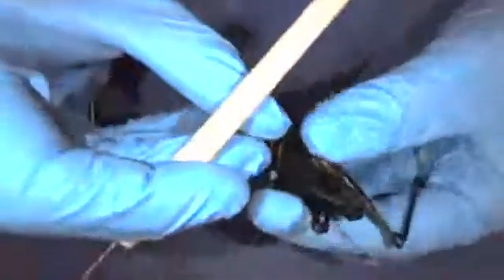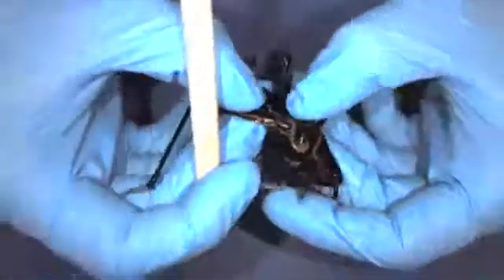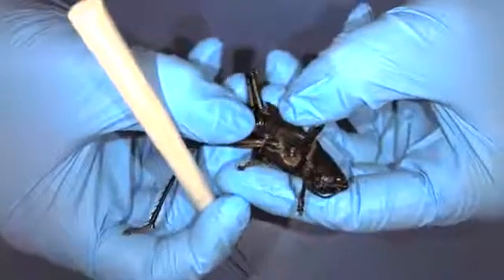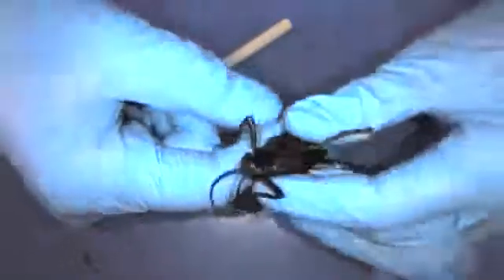One more feature on the outside — underneath the wing, if I can gently lift it here, they have something called a tympanum which vibrates with sound. Underneath the wing you can see that more flesh-colored flat spot. This vibrates with sound waves, so it's kind of like an ear. If a predator is walking up, that tympanum will vibrate and send messages to the grasshopper — 'hey, a bird's going to try and eat me!' — helping them escape predators and find prey.